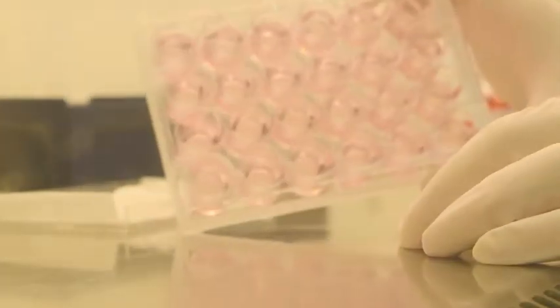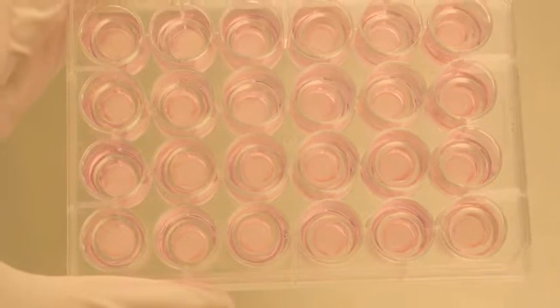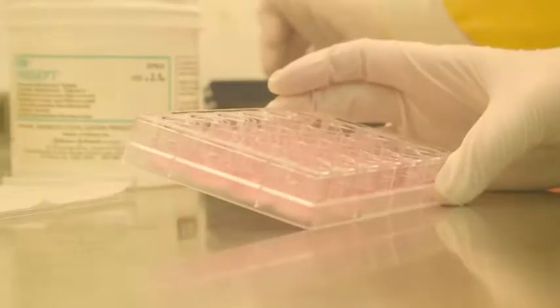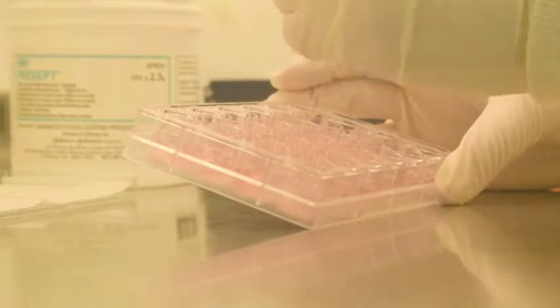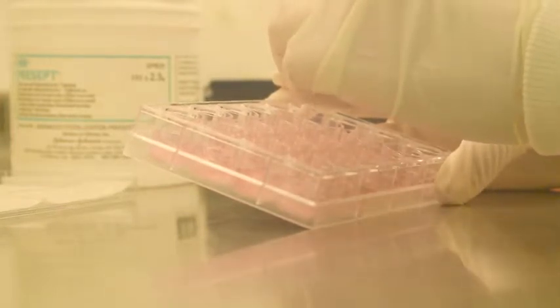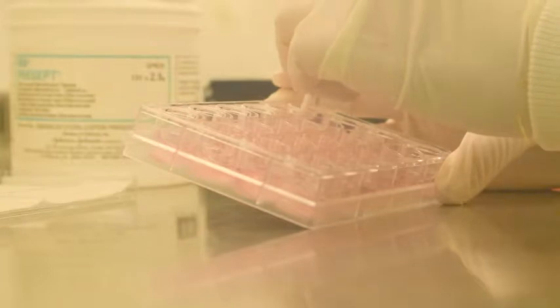Tissues are received in a 24-well plate embedded in agar. Tissues are visually inspected for obvious defects and excess liquid is removed gently by sterile cotton buds.